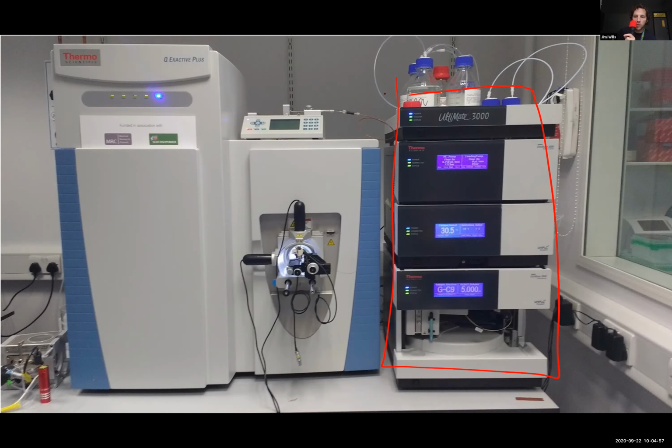But there are many, many other types of mass spectrometer, and I'm going to cover very basic principles that apply to all mass spectrometers. But ultimately, most of what I'm going to talk about applies specifically to this particular mass spectrometer here.